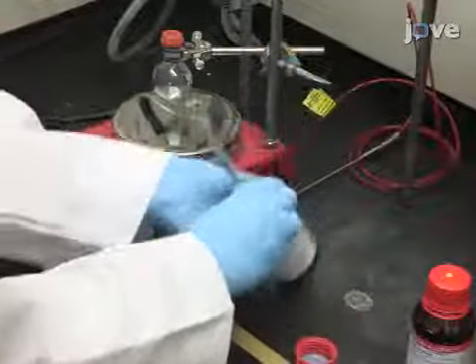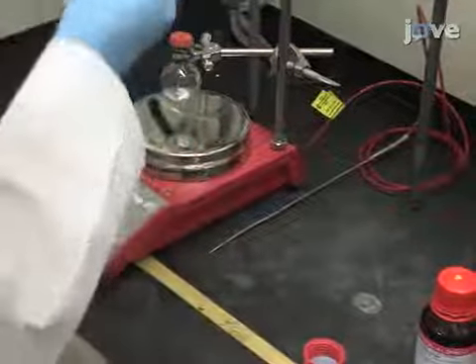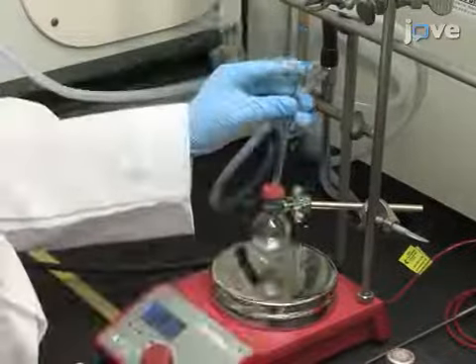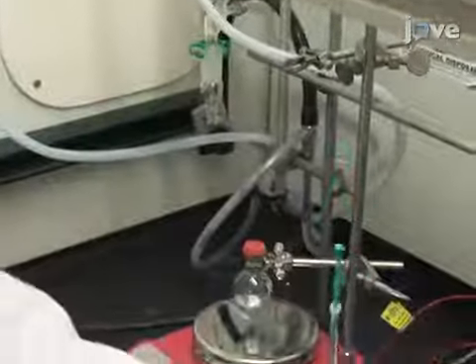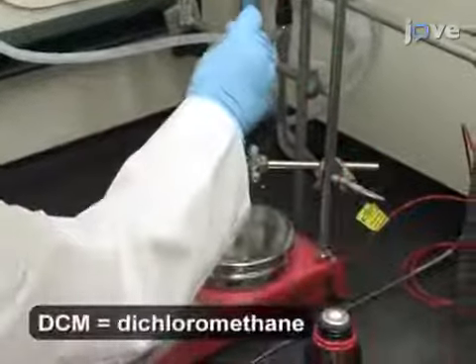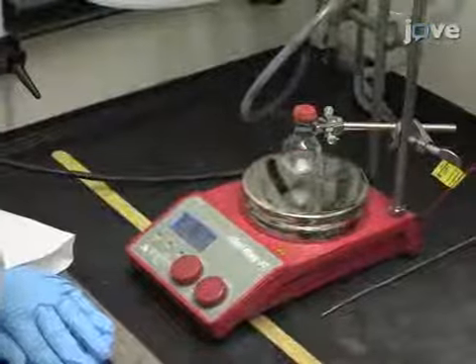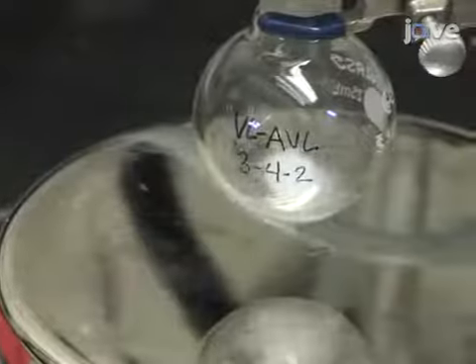Sequentially, add 72.6 microliters of 3-methyl-1-butanol via a 100 microliter microsyringe and 1.33 milliliters of anhydrous DCM via a 2 milliliter syringe. Stir the suspension on a magnetic stir plate for 10 minutes.